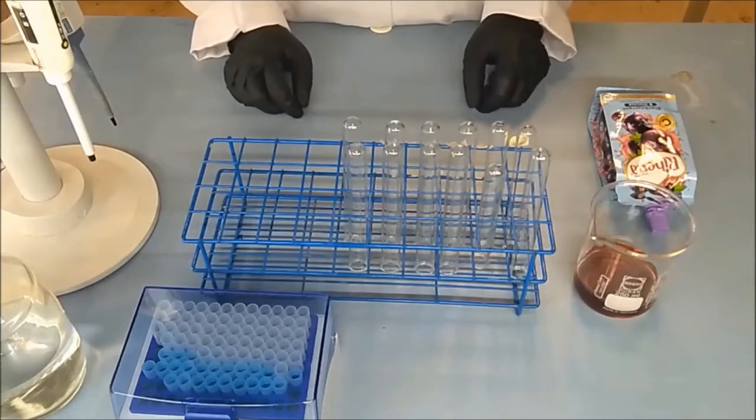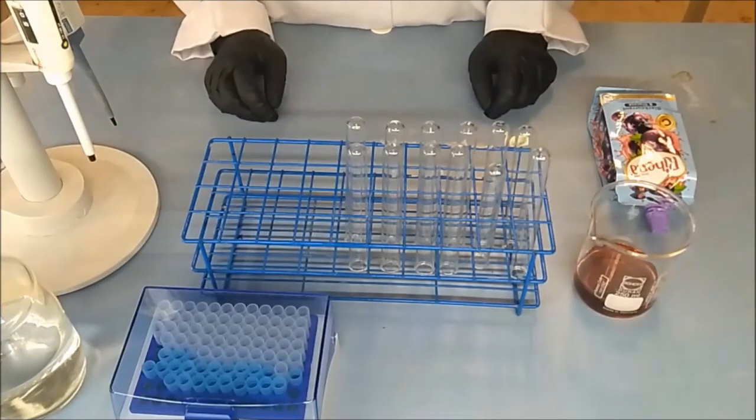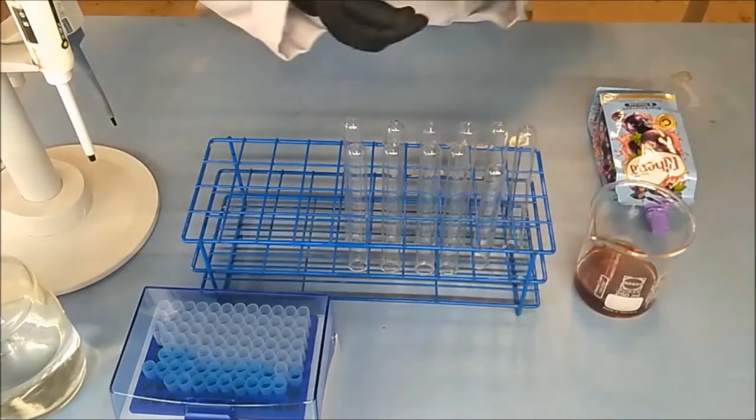Prepare two sets of six clean and dry test tubes. Make sure to label the test tubes to avoid confusion.